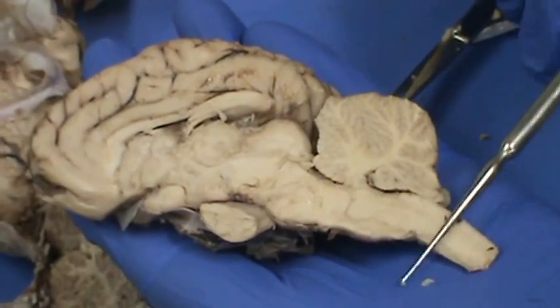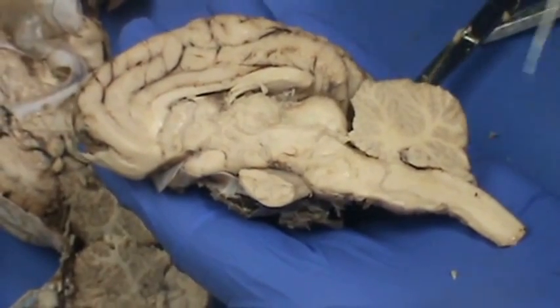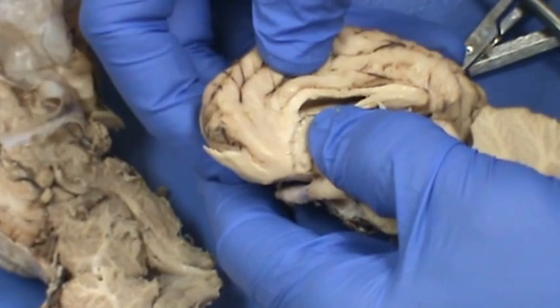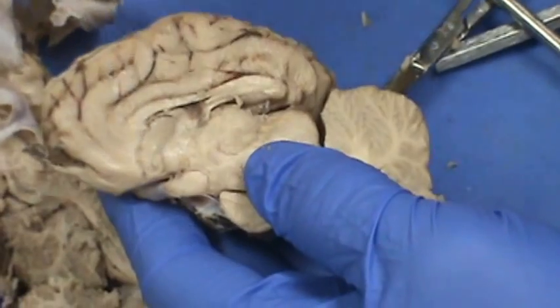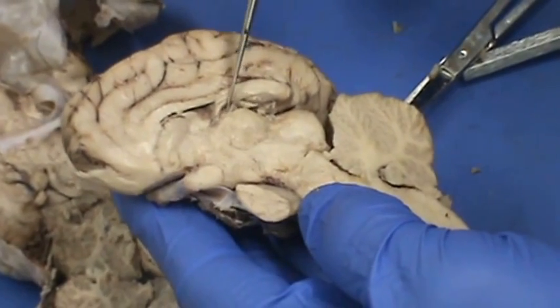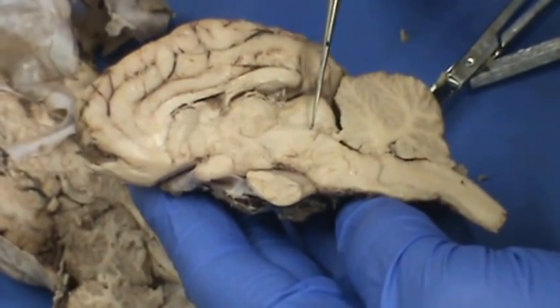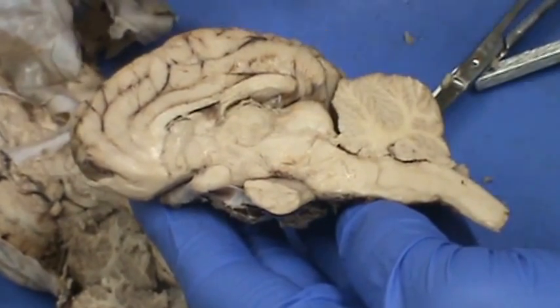This structure here is actually the spinal cord — it's not part of the brainstem. This is the cerebellum cut open. Looking at the ventricles: you have a ventricle on the right side of the brain that goes around the corpus callosum — that space would be your right lateral ventricle. On the left side you would have the same — the left lateral ventricle. Around the thalamus is the third ventricle, and the fourth ventricle is between the brainstem and the cerebellum. The aqueduct of sylvius is right in this area, where cerebrospinal fluid travels from the third ventricle to the fourth ventricle.